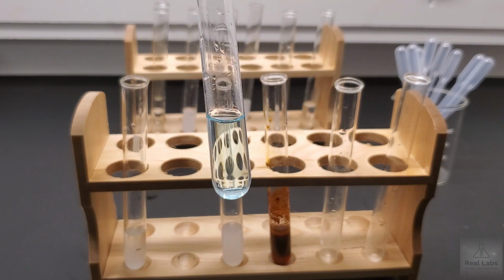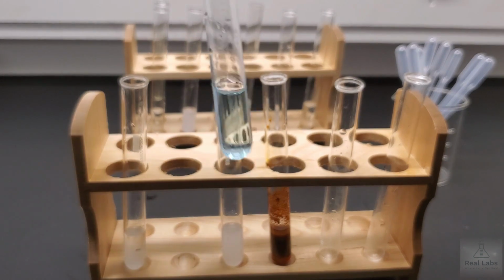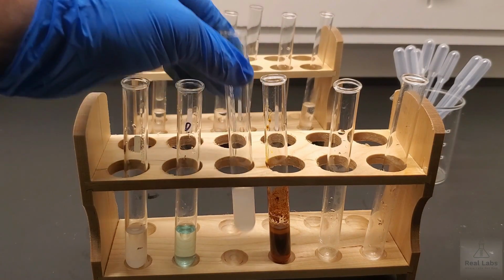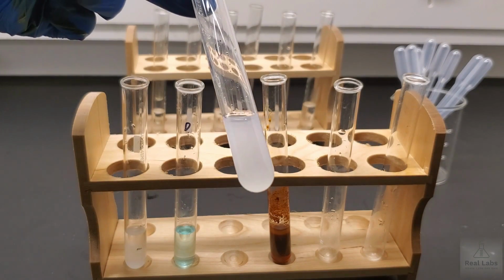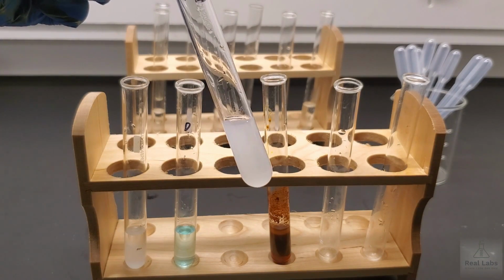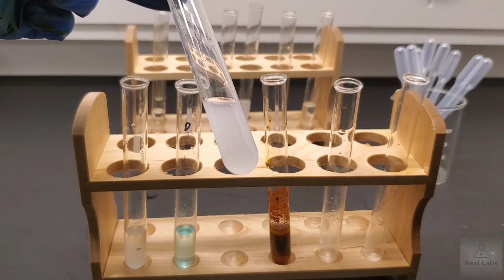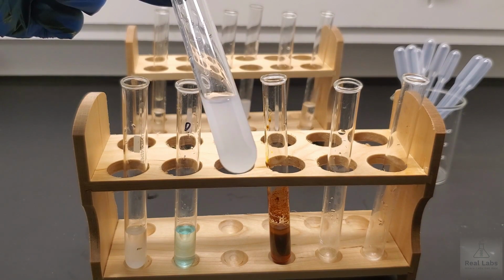Here's our copper sulfate one with the ammonium chloride. Then we mixed sodium hydroxide and nitric acid. As you can see, again, this was cloudy as well. And this is where in science you have to really pay attention and take good observations, because again, I personally wouldn't have expected a reaction here, or at least not a visible reaction like this where a solid formed.